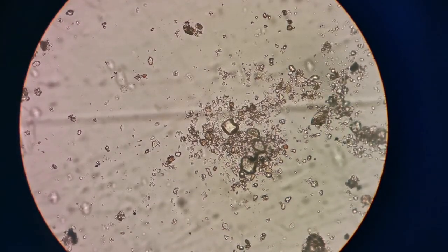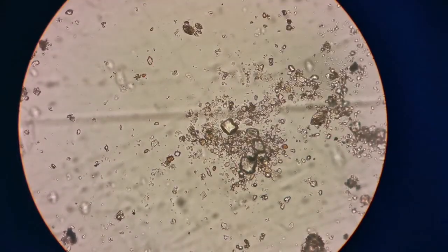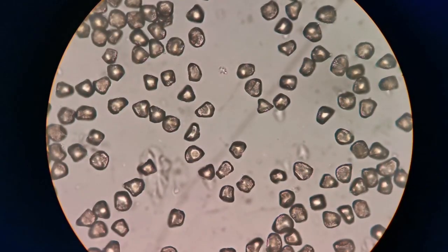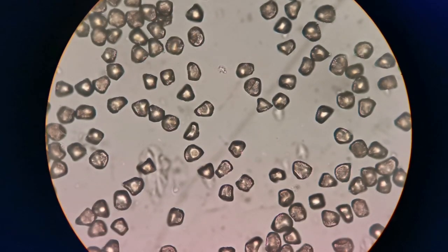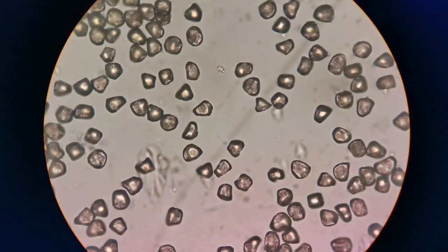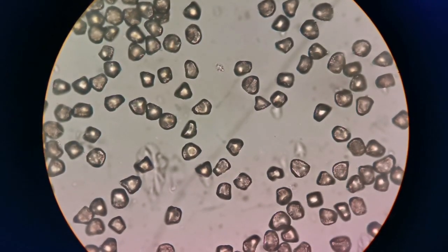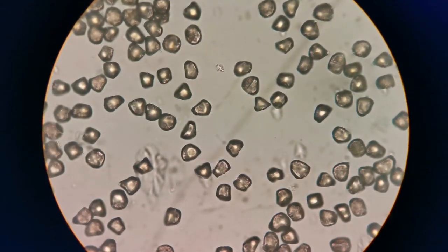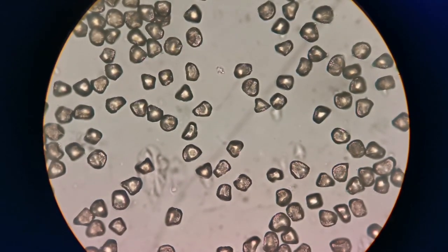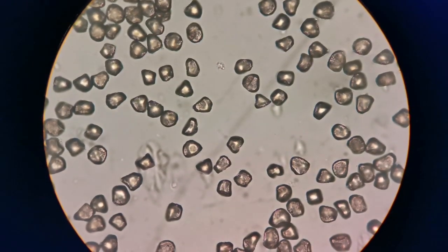Let me just put another slide of the pollen just to see how it is. But just compare it. So you can see the pollen here. They're very uniform shaped. So three-dimensional triangles, and they are kind of as if they have been hit by something. They're dry. The shapes are very uniform. They're not bigger than what you see, at least for the yew tree that we have.